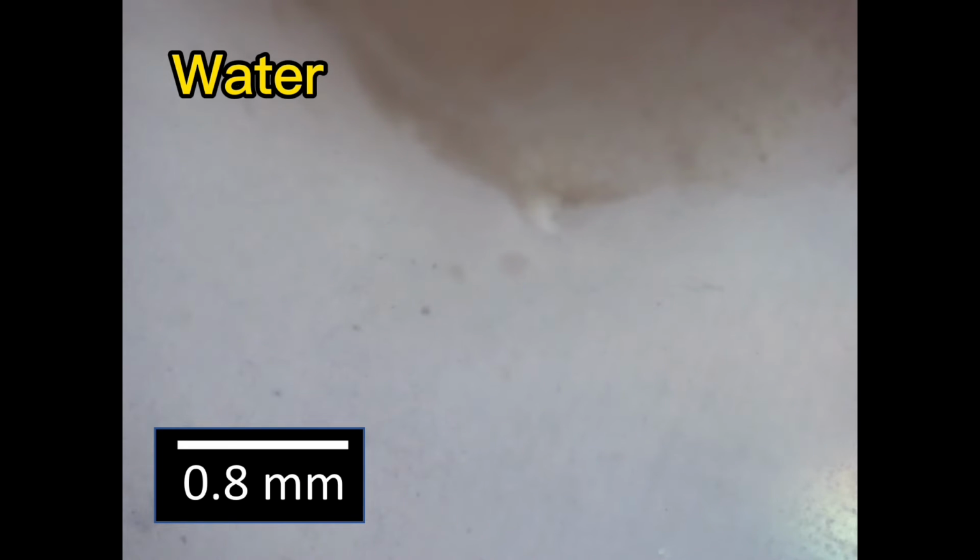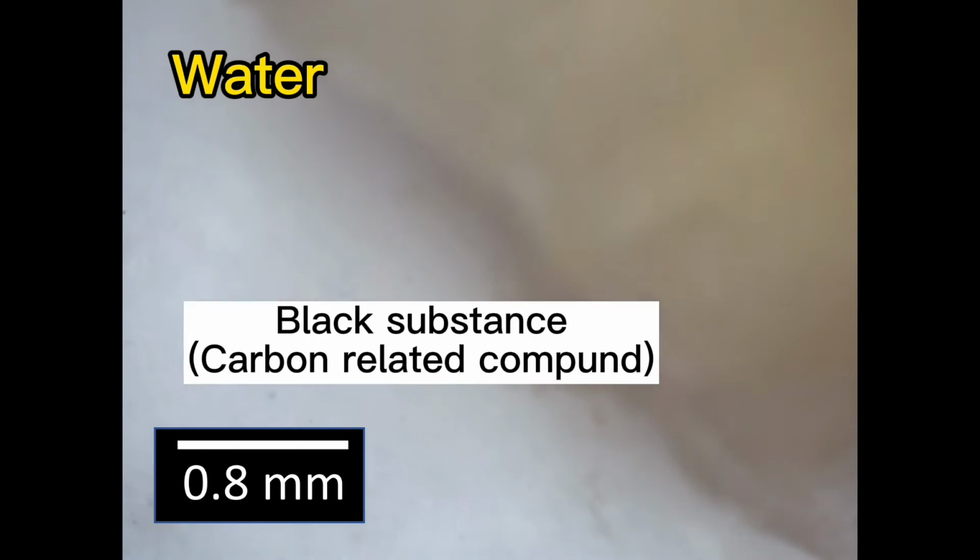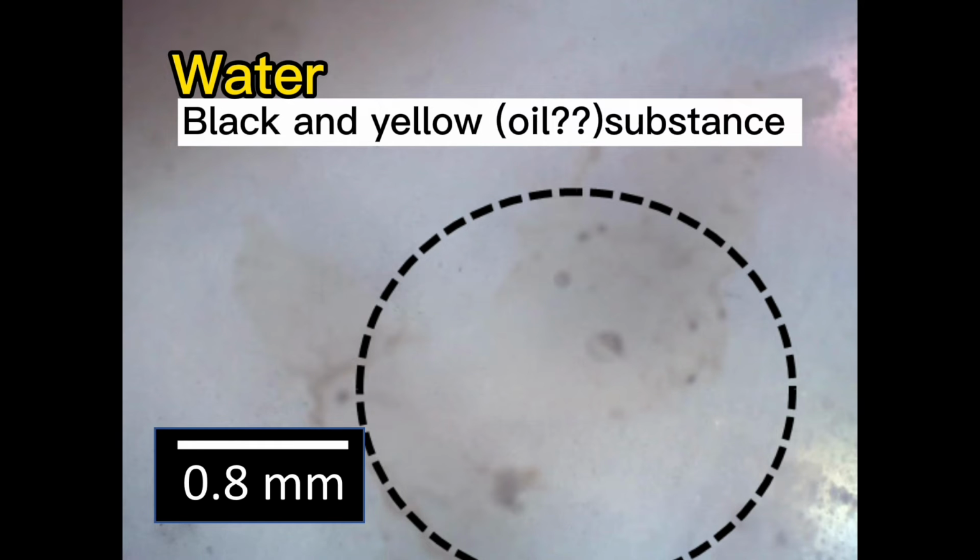When we use the microscope, it can be observed that there were many suspended substances in the water, most of them black and yellow, which might be the carbonized compound or solidified oil separated from the fries.